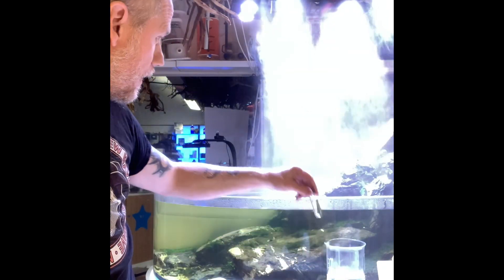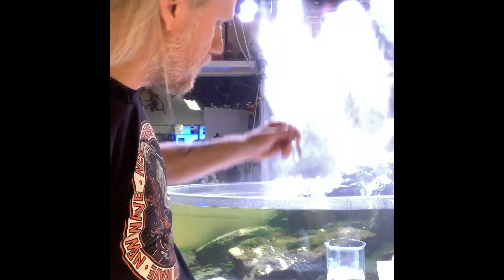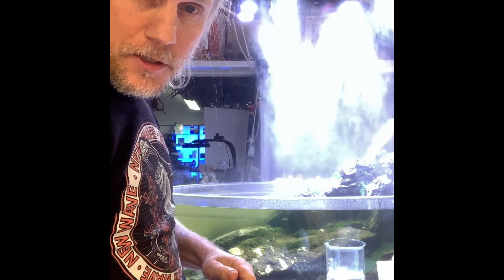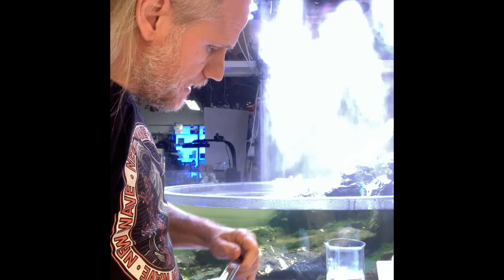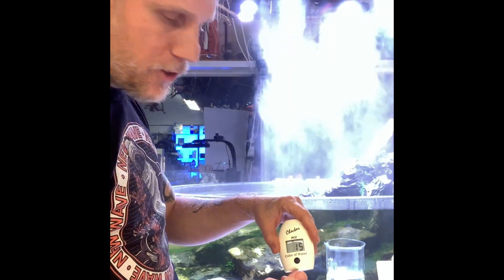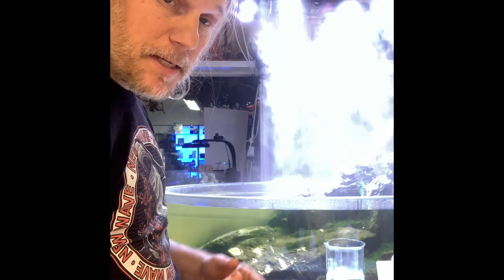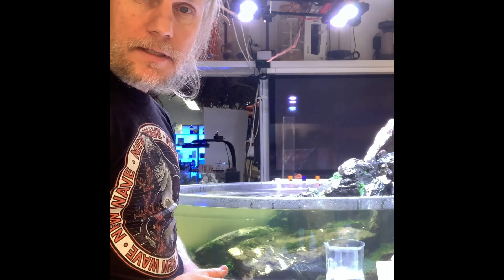I should also mention: if you have these vials in an environment where it's humid or raining, you should never touch them with your fingers, because that's going to mess with your test. There's a small LED light inside the device that shines through the vial and measures the color, so if the glass is smudged, the test is not going to be good.